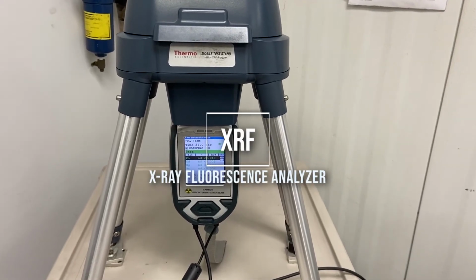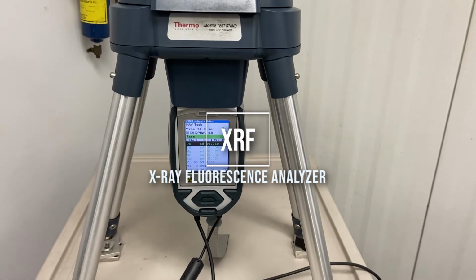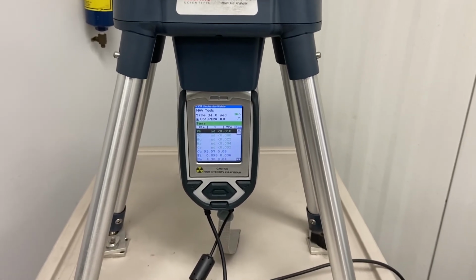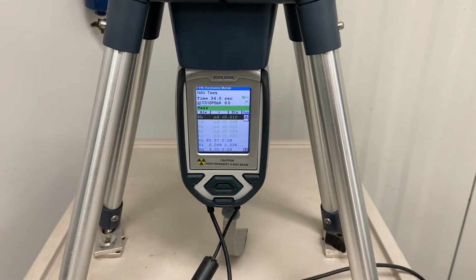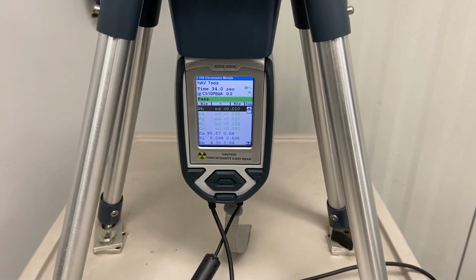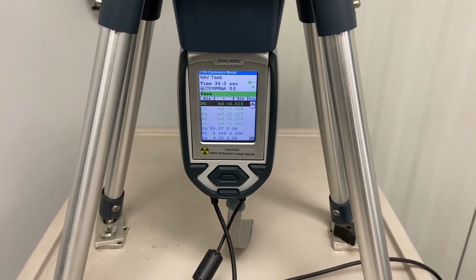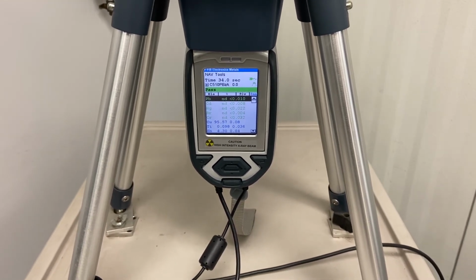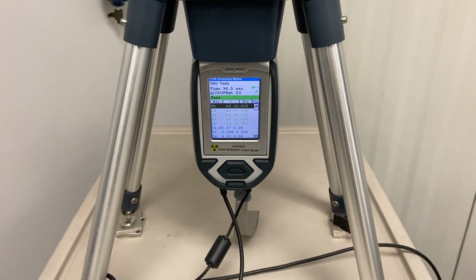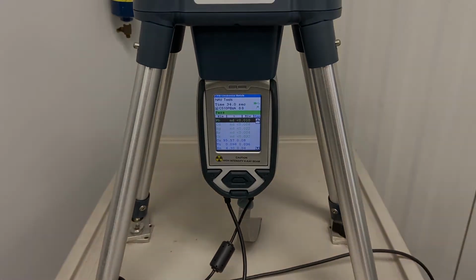The X-ray fluorescence analyzer, or XRF, is used to aid in sample identification for bulk samples. The XRF uses characteristic X-ray emissions to indicate which elements are present in a sample and their relative amounts. It works on a similar principle to the EDS, but the excitation is carried out by X-rays instead of an electron beam.